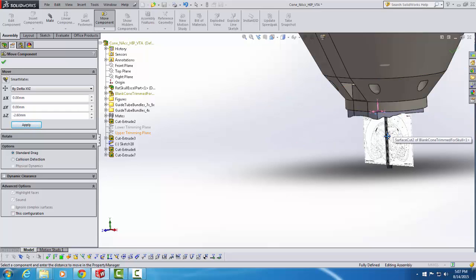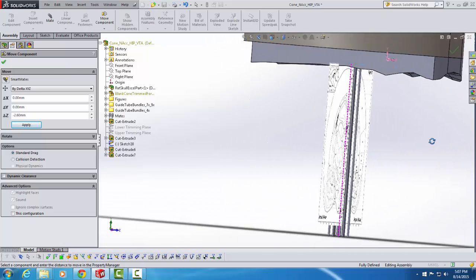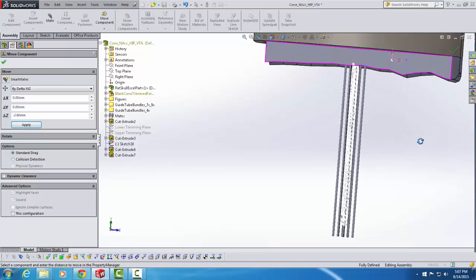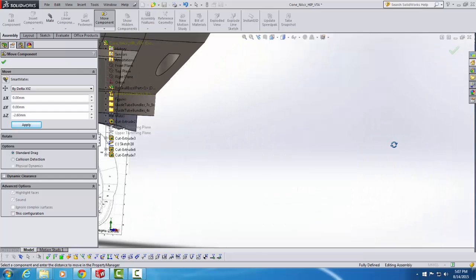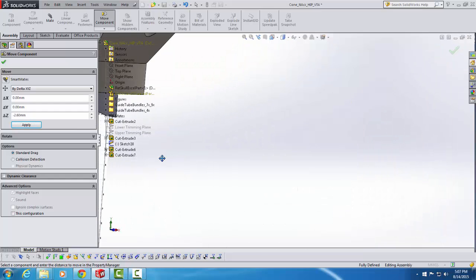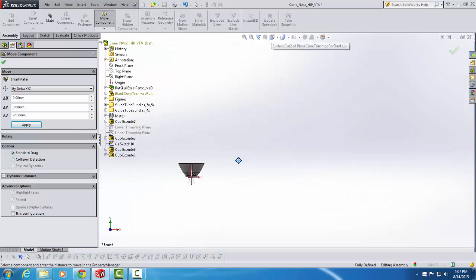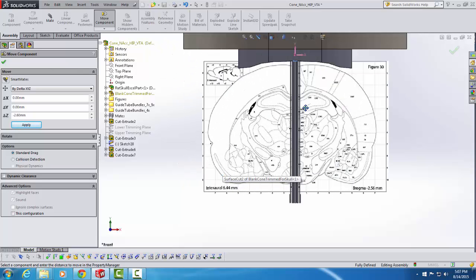You can see that the bundle moved, and I'll zoom in so you can see it better. Now the bundle is almost in the same plane, because the plane is actually at 2.56 rather than 2.6, but close enough. It's almost in the same plane as the figure, and I can use the figure now to guide me in positioning it in the medial-lateral dimension. So before I do that, I'm going to go back to the standard view and then choose this frontal plane again, so that I can get a nice head-on view as I try to move this medial-laterally to where I want it to be.